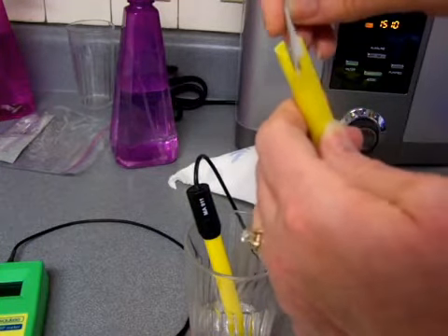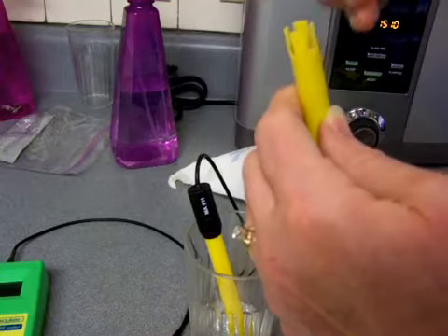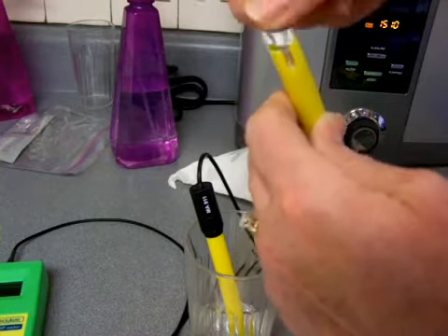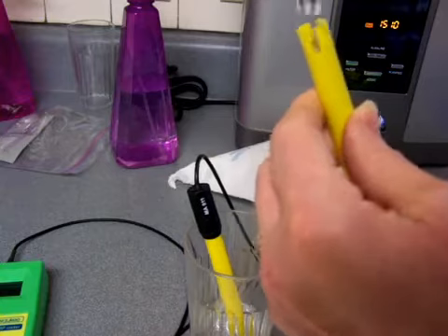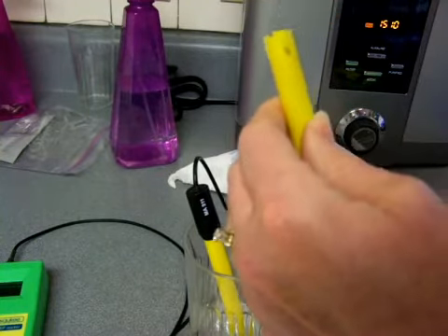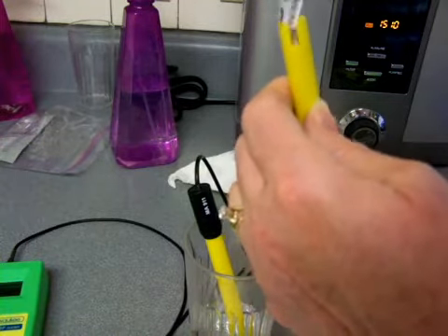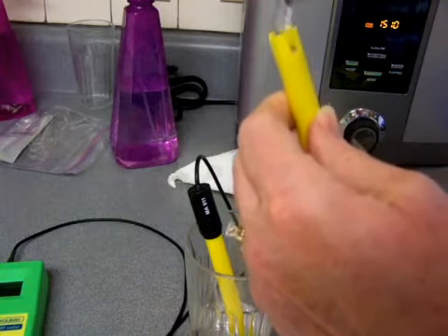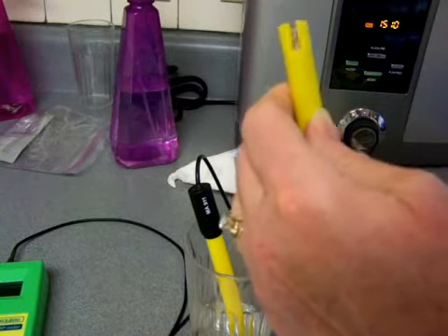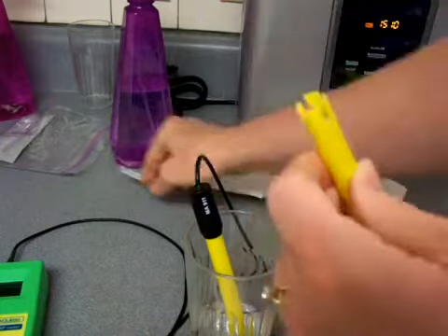And if you really are looking closely, you can see the white specks and whatnot that have formed on the probe. Then I'm just taking it along the top of that little probe and brushing it there. I kind of go in this way and brush it, and I just do like a minute's worth of this. And when I've done a minute's worth, I'll usually test it, and that'll let me know how well I'm doing. I don't test it just because I think I'm done cleaning it. I test it because I might be done cleaning it, so I don't want to overclean it.